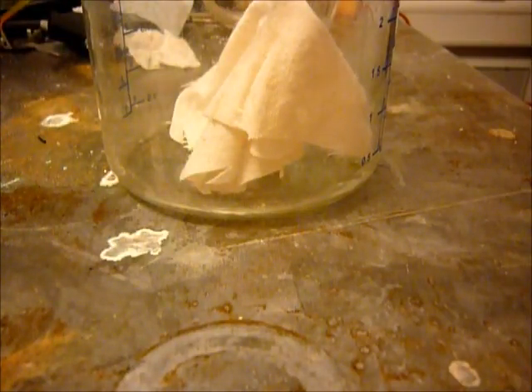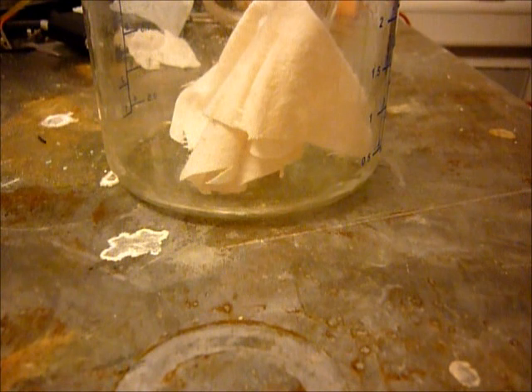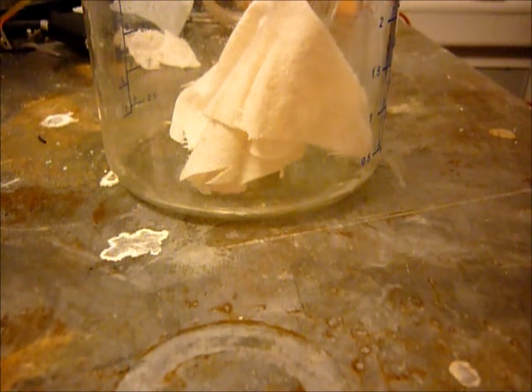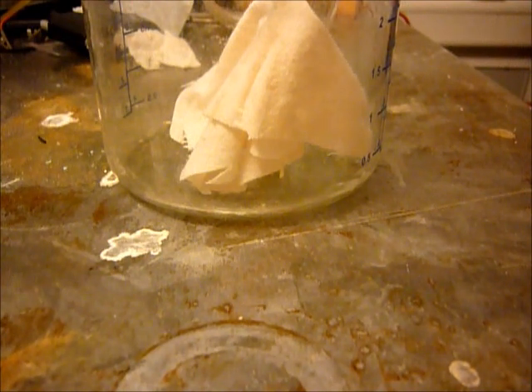Sulfuric acid is a very good dehydrating agent, also oxidizing. Not as well as nitric acid, but still oxidizing. To demonstrate this, I have here a piece of cotton.